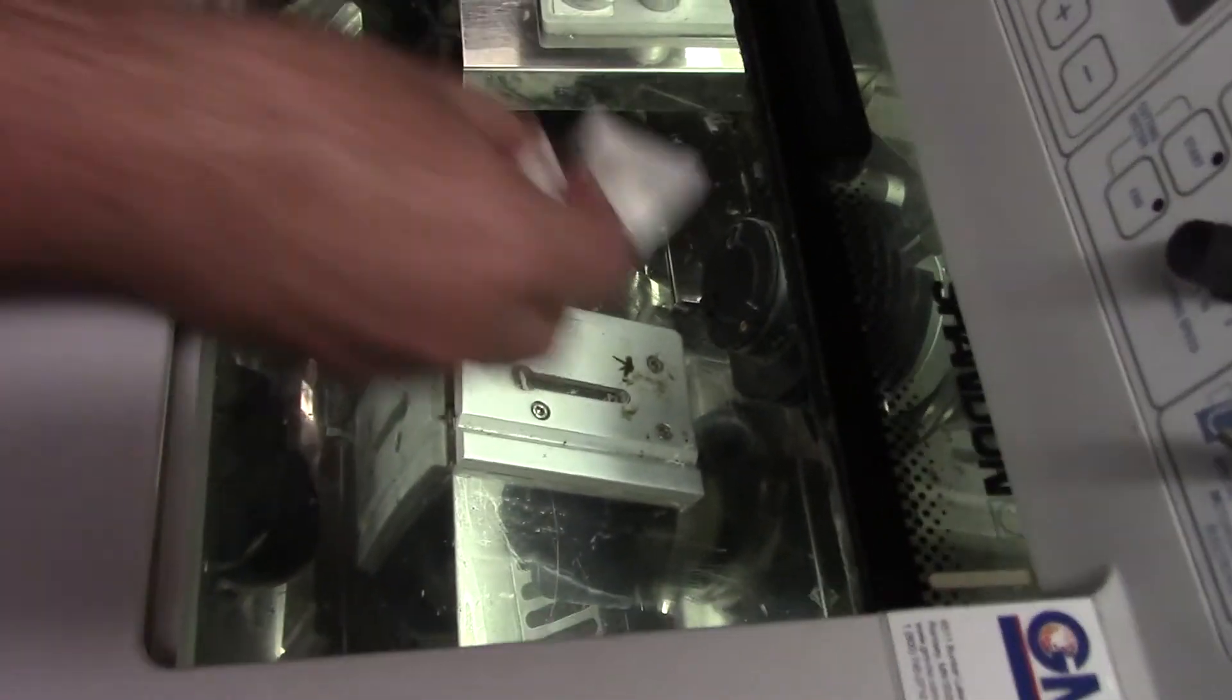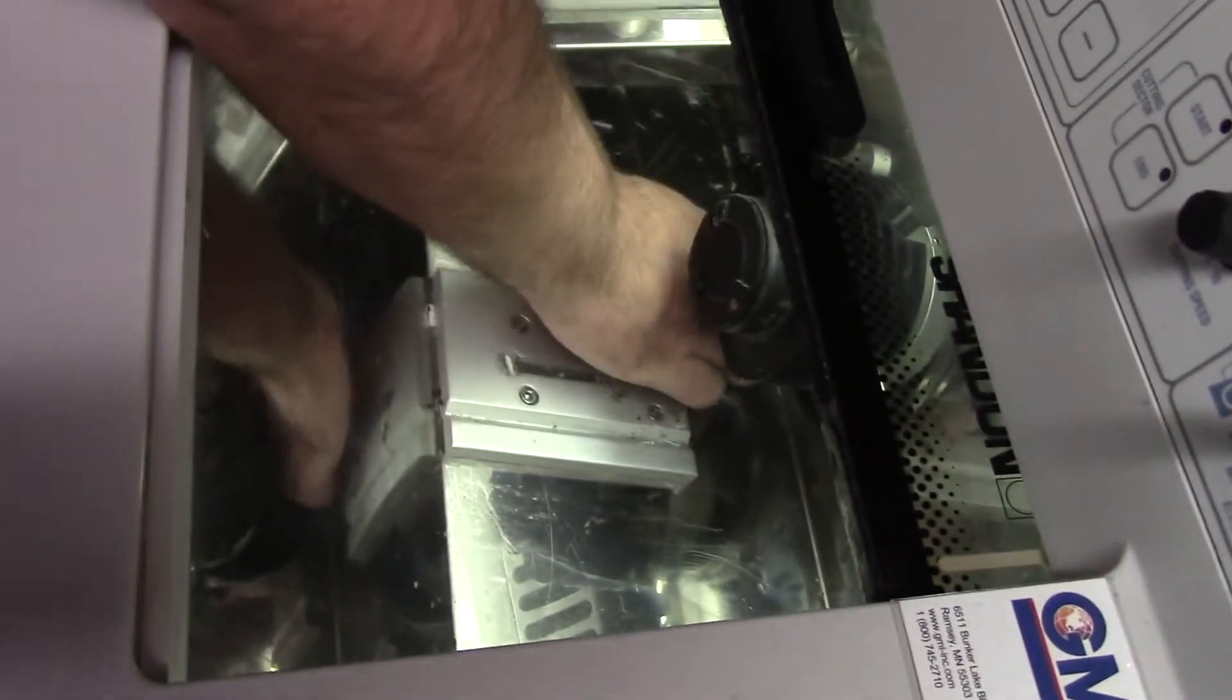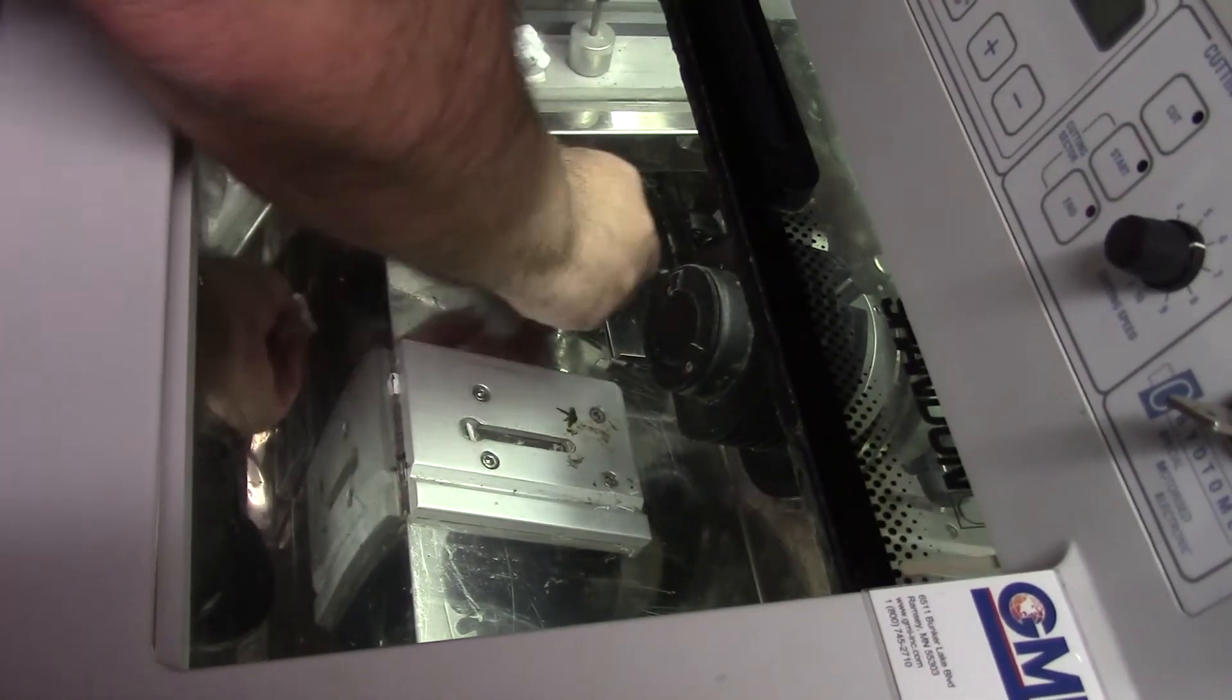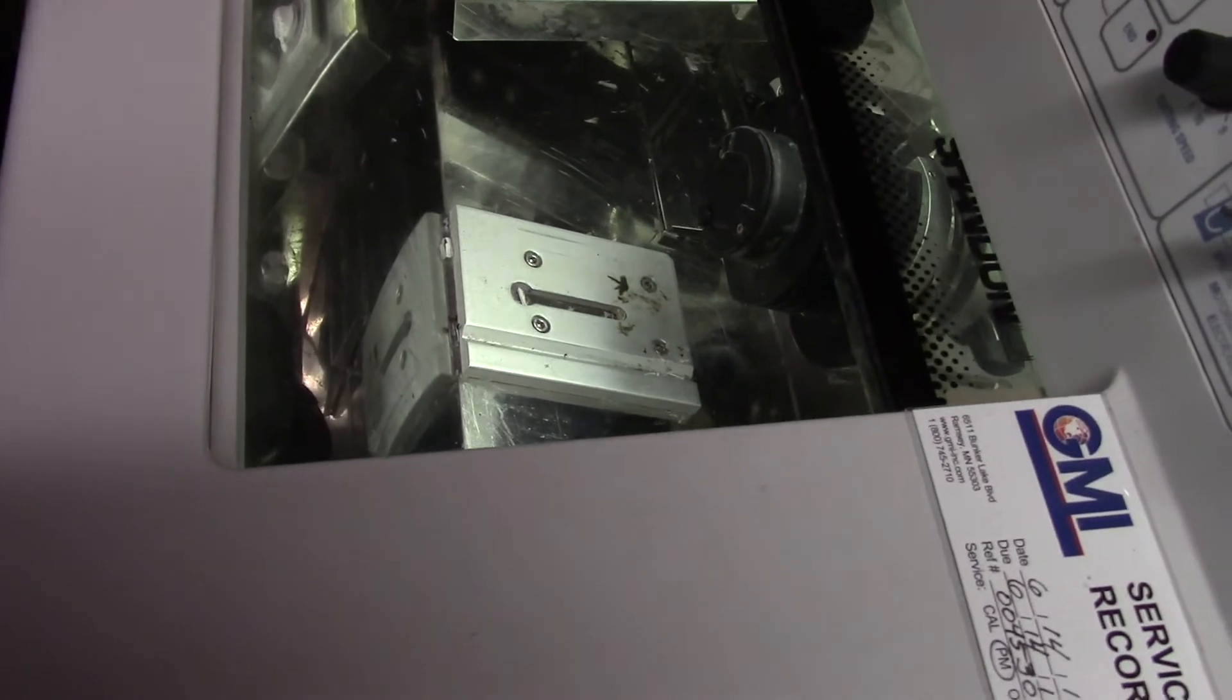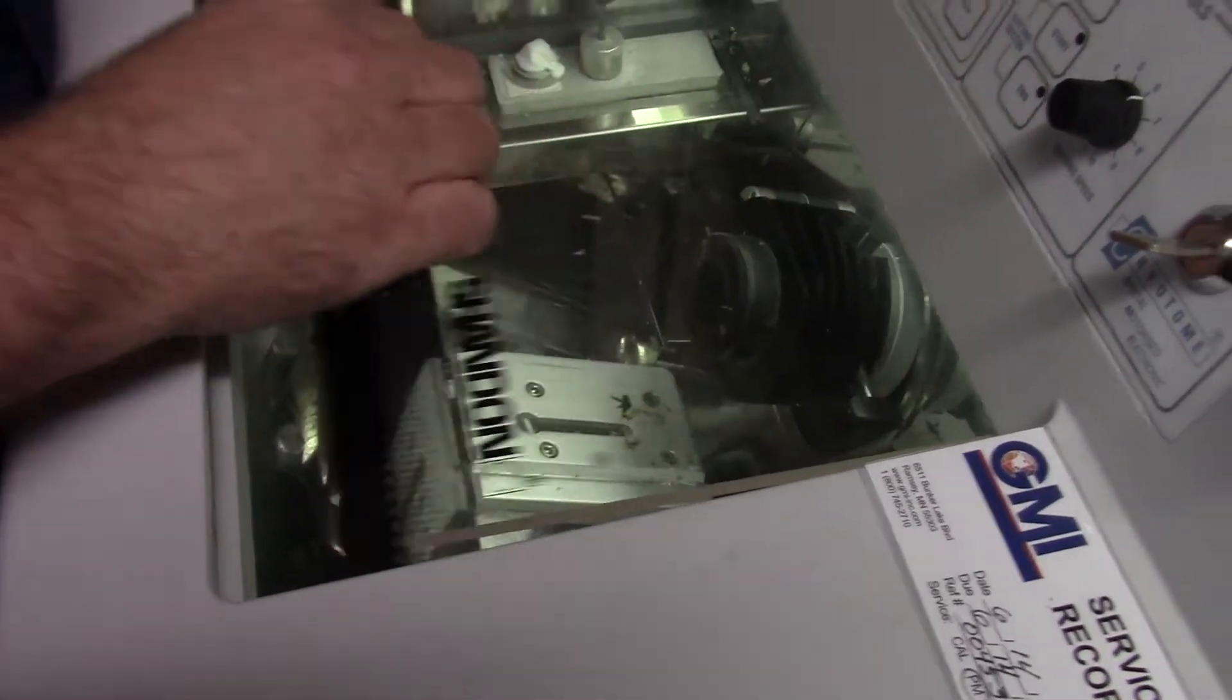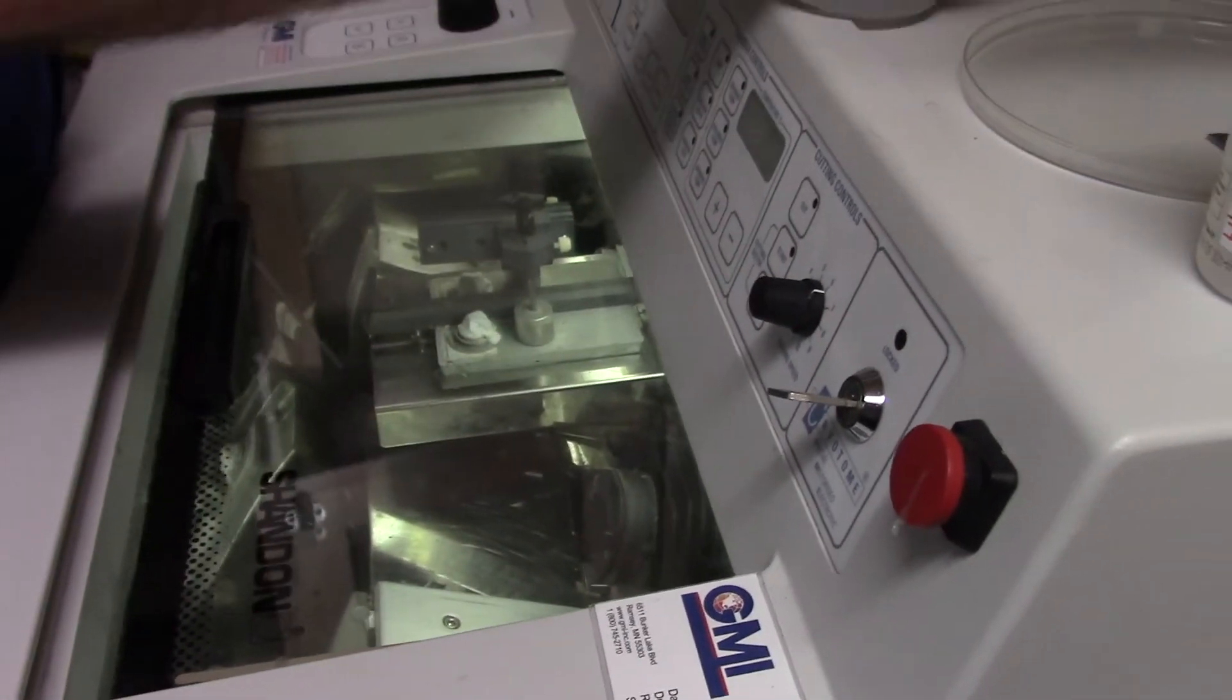If you knew you were going to use this the next day, I wouldn't say you need to do such a thorough cleaning that you actually remove the blade holder, but you always will want to wipe down whatever you have been using.